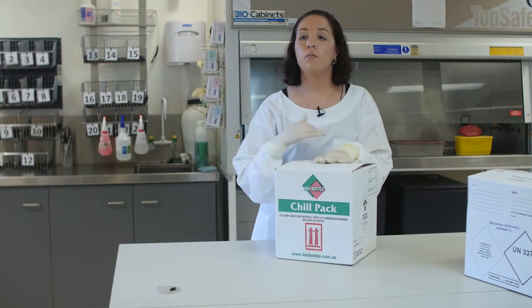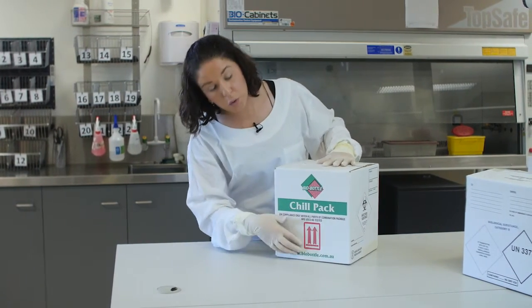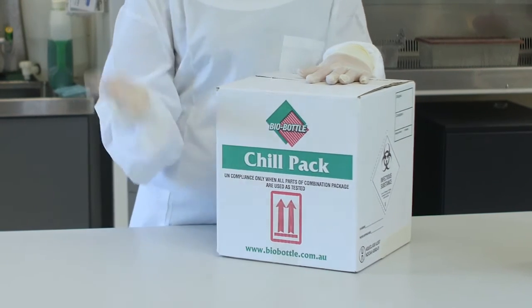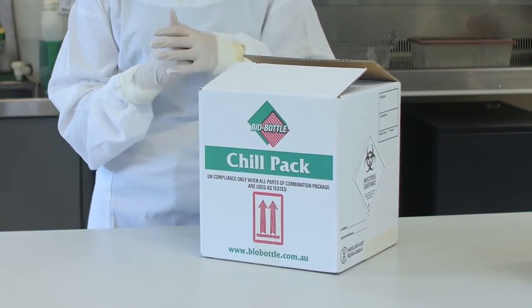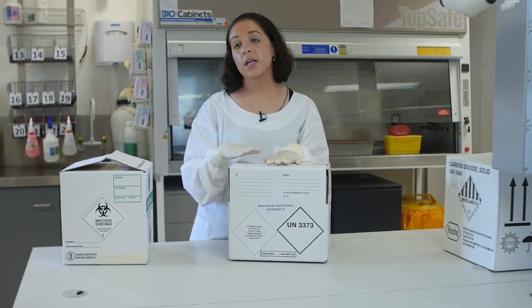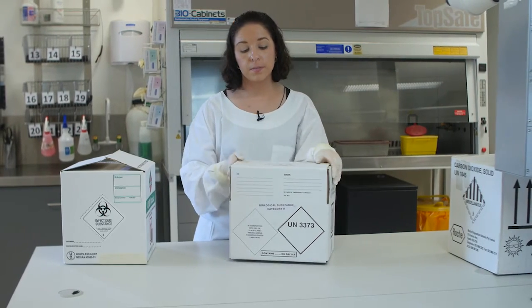Should your parcel contain more than 50ml of liquid, you'll need to ensure that orientation labels are present on the box. This ensures that during transport the package will remain upright at all times. Category B boxes can be any cardboard box as long as it has passed the 1.2 metre drop test.